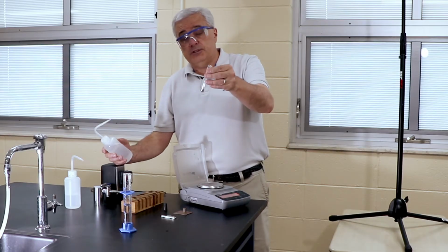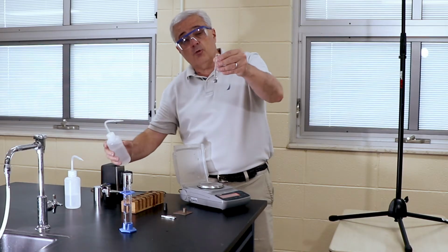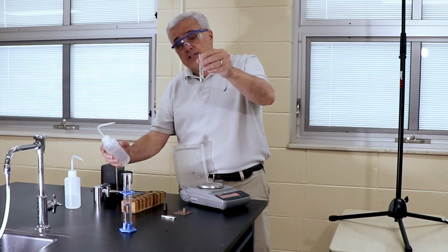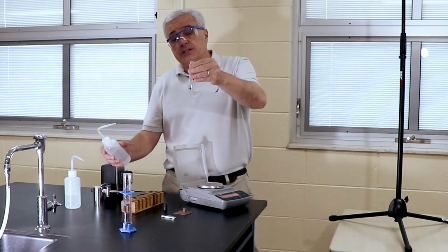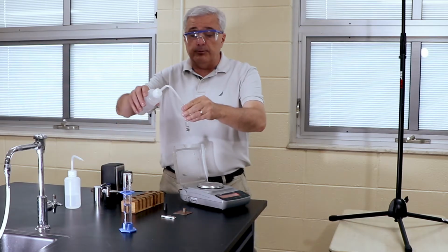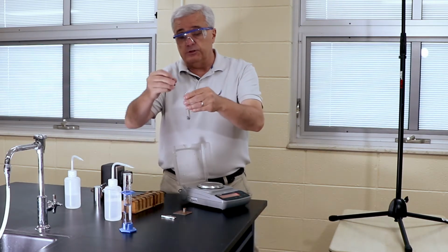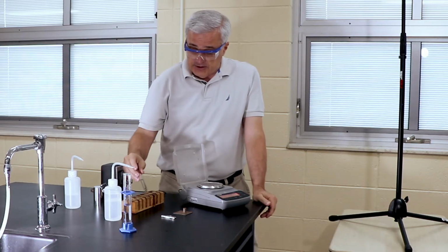There's no precipitate forming. None of the evidences of a reaction. So we'll put a little more water in and see. Nothing seems to be happening. So the next thing we want to determine is, will it dissolve? So I'm going to put a little bit more water in. And in order to agitate it without spilling it, I'm going to put a stopper on it. I'm going to let it sit for a moment.